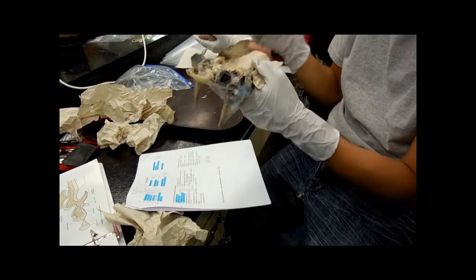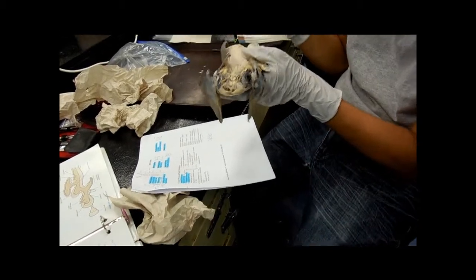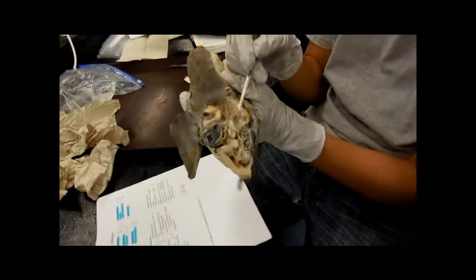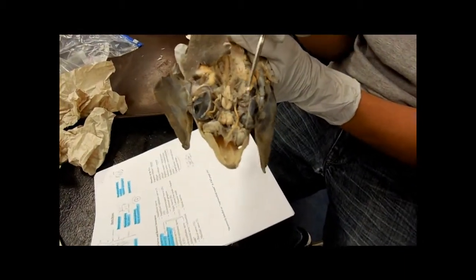Okay, I'll just go through them one by one. If we're gonna start at the very top, there are two of them that are apparent. It's this one and this one.